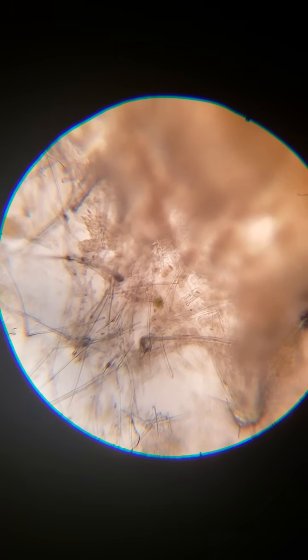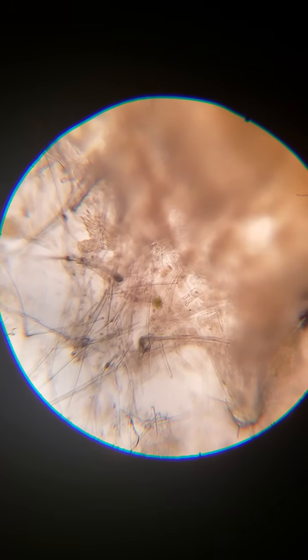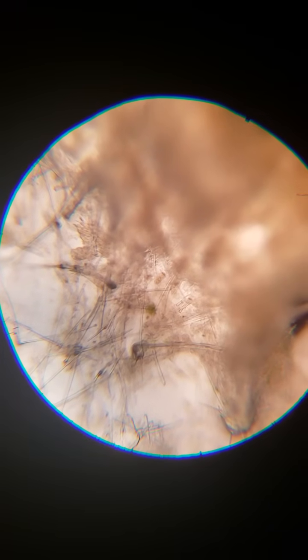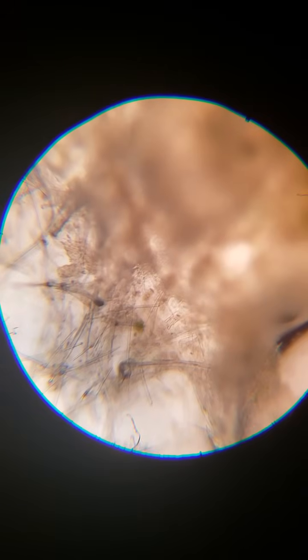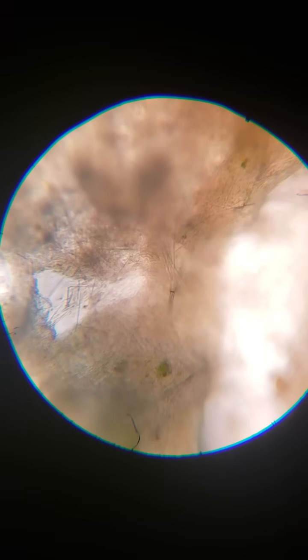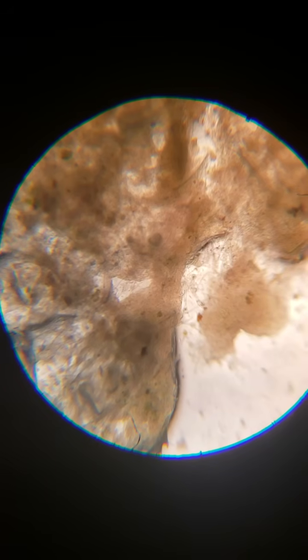But that is forming, it's a clump that gets denser and denser. And as I said, it can go out on its own, go dormant, and it has all the information for life for a sponge. And here is that more spongy look that we're accustomed to. If you see it here, let's pop back into the lowest magnification. And that looks more like a Brillo pad sponge right there, especially that little breakaway piece.